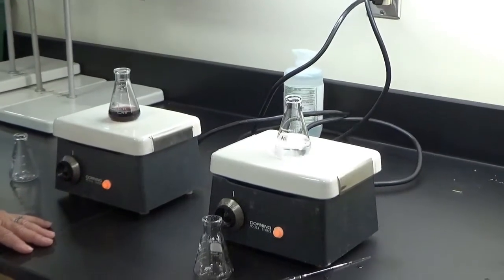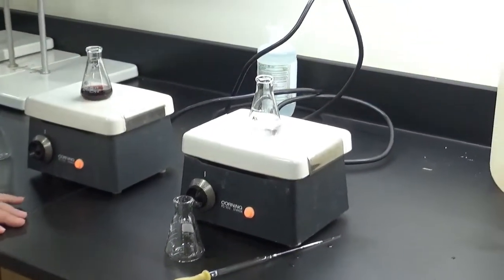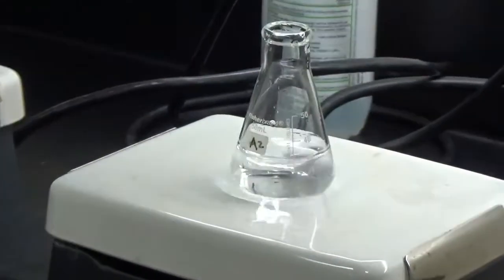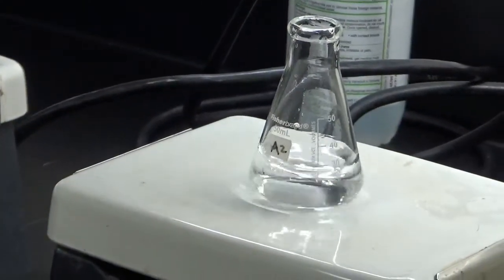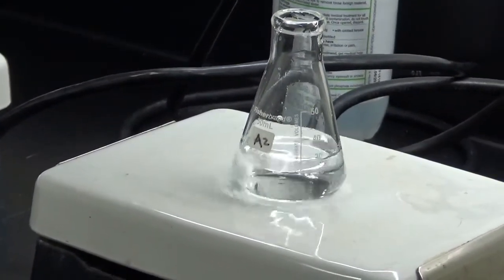I'm sure it's just a little bit more. You have to have patience. It's going to turn now.